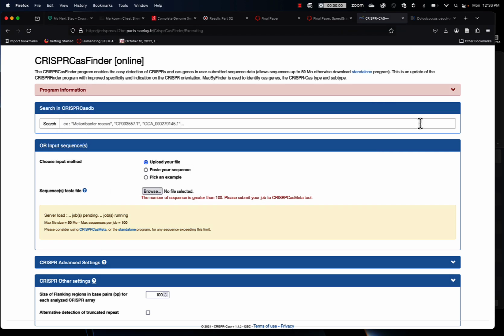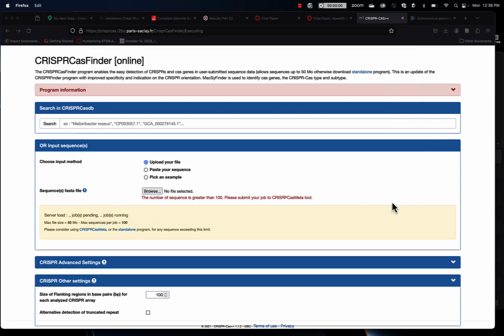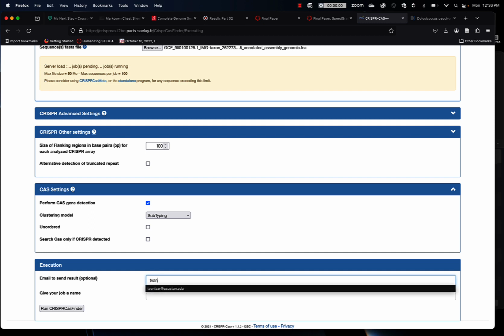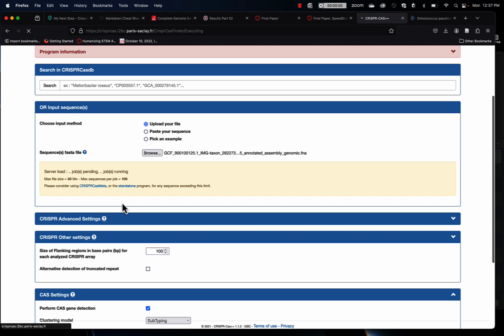So now I'm going to upload this one that I've cut and see what happens. So you just have to cut out some of the pieces, because it can be too many pieces. So you just cut out into a new document and then you run both. So let's run the CRISPRCasFinder. Let's make sure I cut out enough pieces. I think I did. We'll find out. So I didn't get the error message. So it looks like it's running.